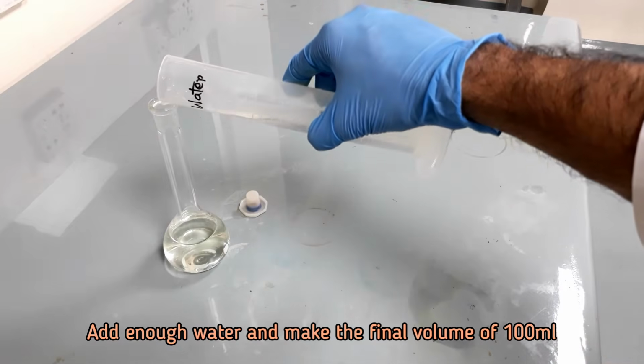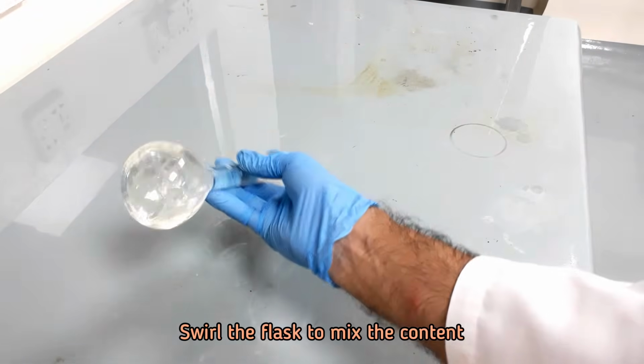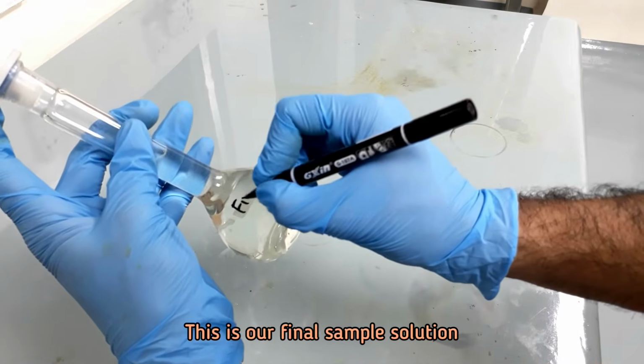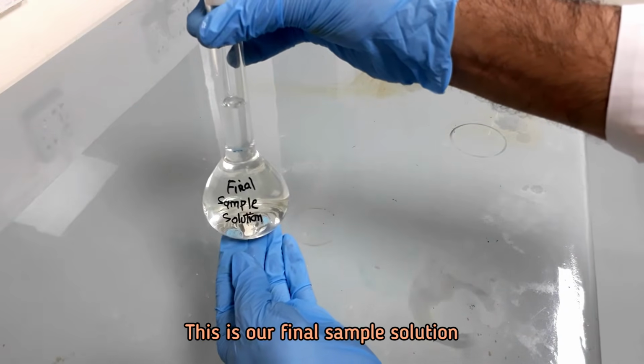Add enough distilled water and make the final volume of 100 ml. This is the final sample solution.